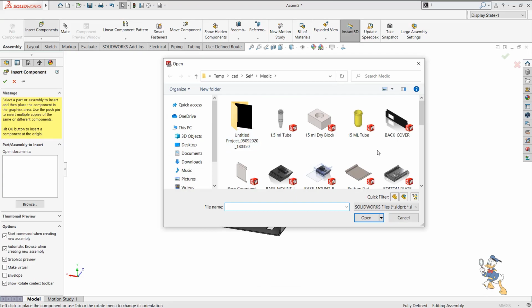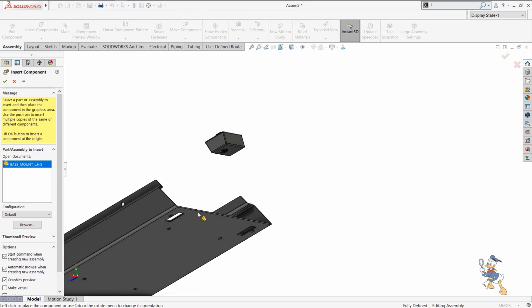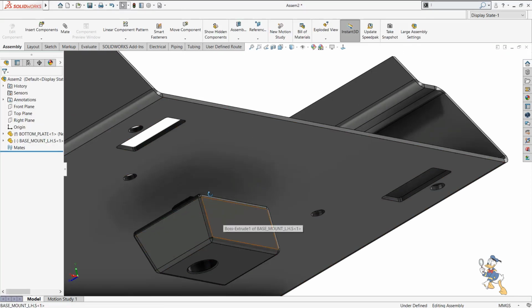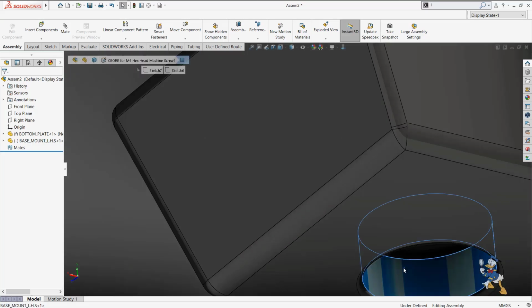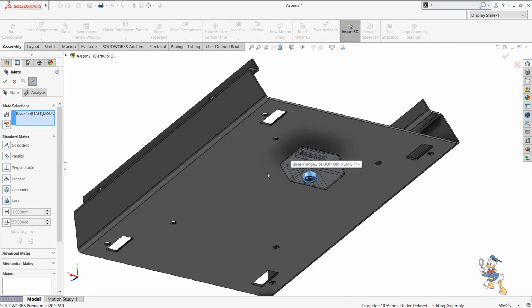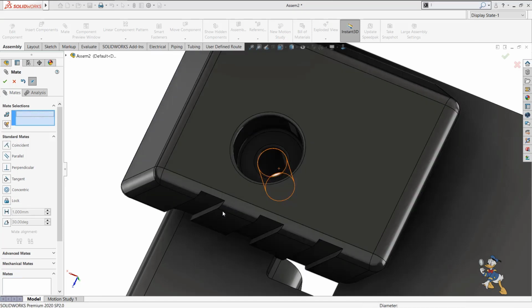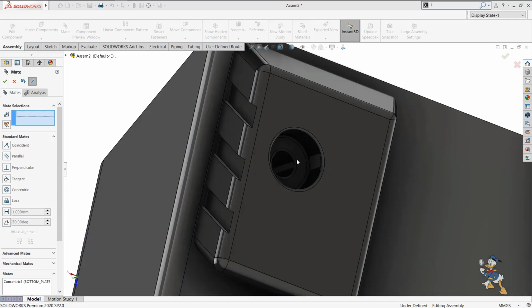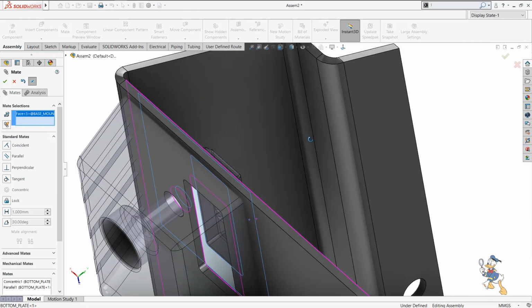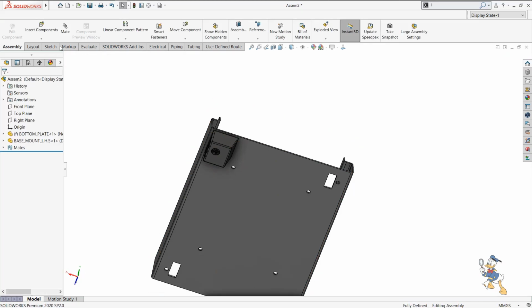And after this I just need to assemble some sort of base mount. So I will select a base mount here, and I just need to provide a concentric feature. As you're watching, there is a hole in it, and this would be like this hole for this. Okay, and I will provide a parallel feature to this. It would be like this, and then I just need to select a coincident mate to make things happen. So this is how we can mate and place the components easily.